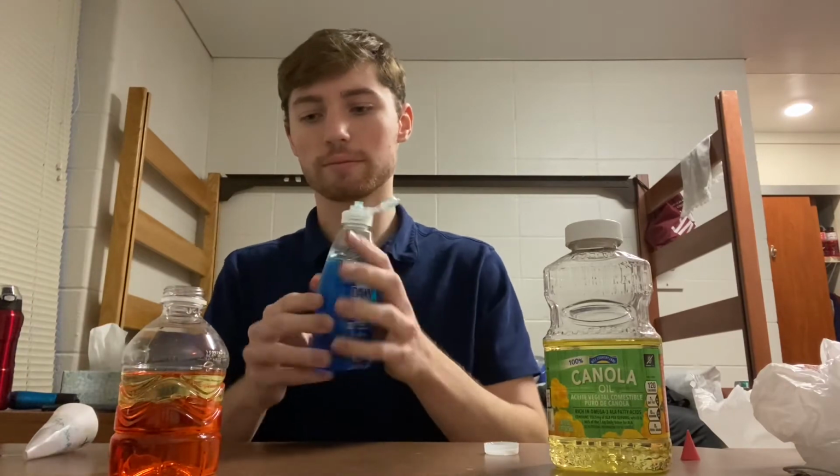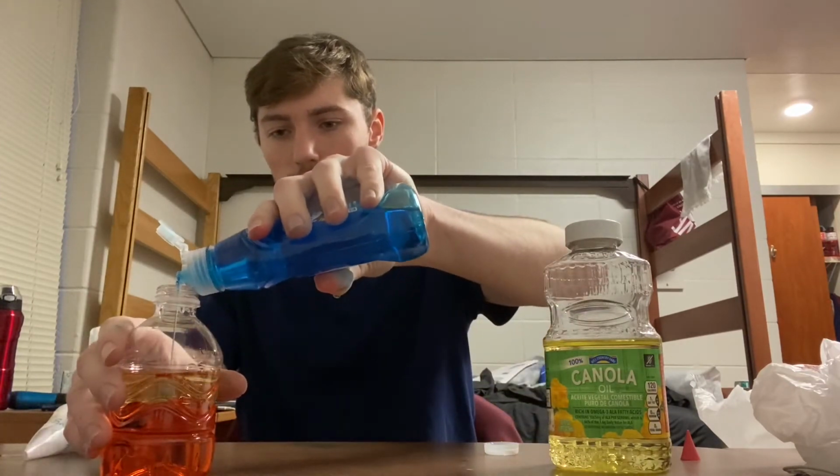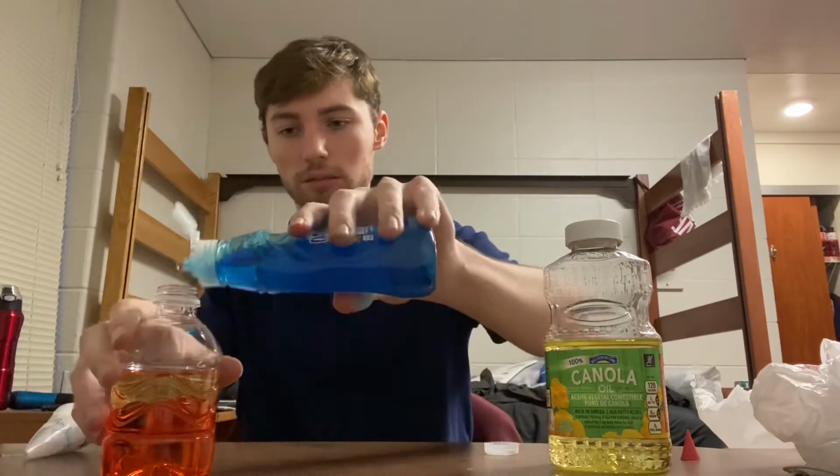So let's add it. Add a little more. And let's close the lid.